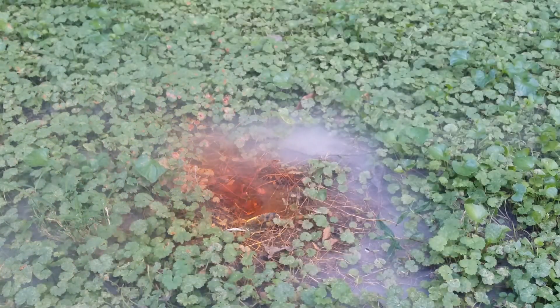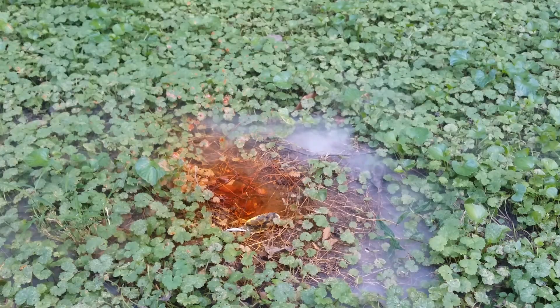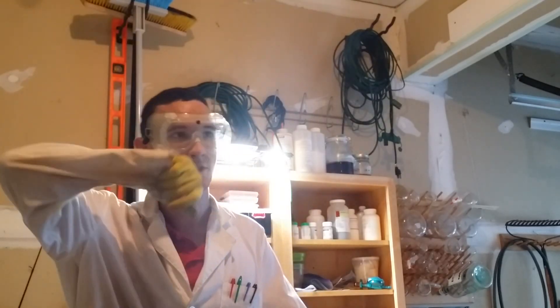That's why you want to wear a face shield when doing something like this, plus a lab coat — that way the splattering pieces of bromine don't touch your skin. Sometimes the reaction with aluminum will catch fire, but mix it with liquid sodium — boom. That is the perfect example of why you want to wear face protection. Had I not been wearing face protection, I would have wounds from bits of bromine splattering across my face, which would corrode right through my skin and do some serious damage. So that is why you wear face protection always in the lab so you don't sustain any major injuries.